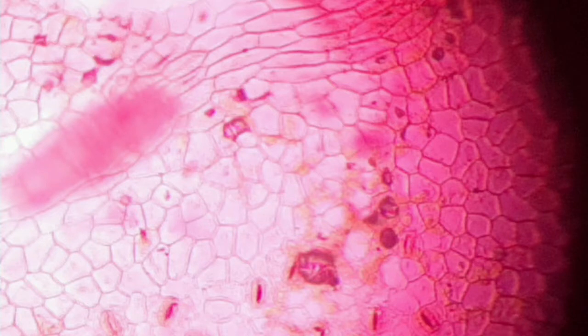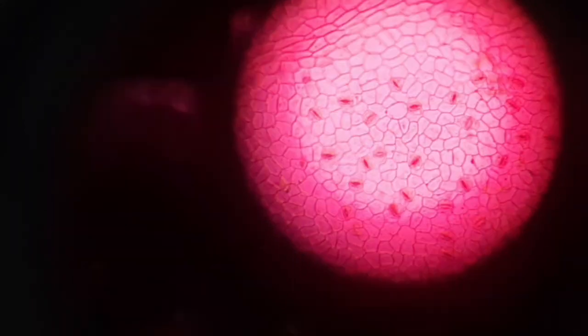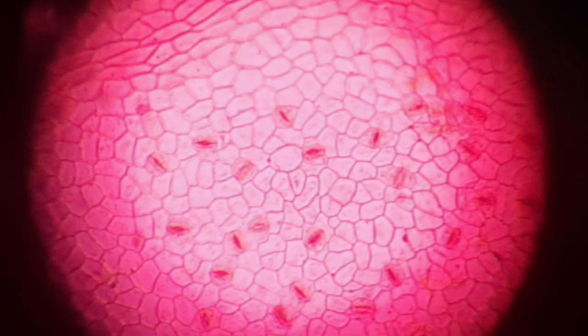And in case when you take these leaves in early morning hours or during the day time in the morning hours, you will see that the stomata remain open. So this was the activity for observing stomata in the under surface of the leaves of the terrestrial plant.